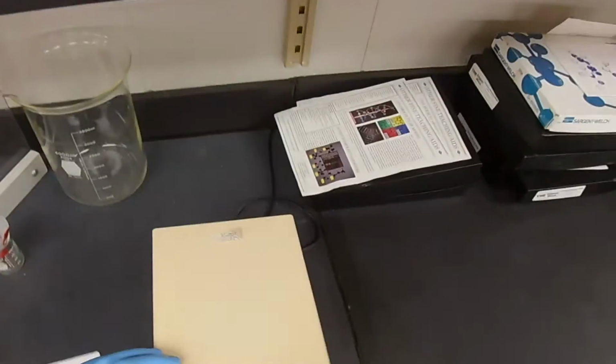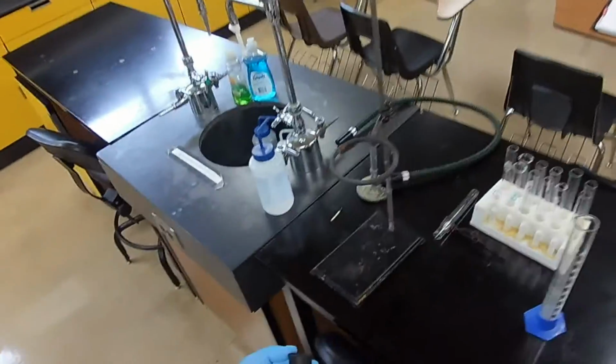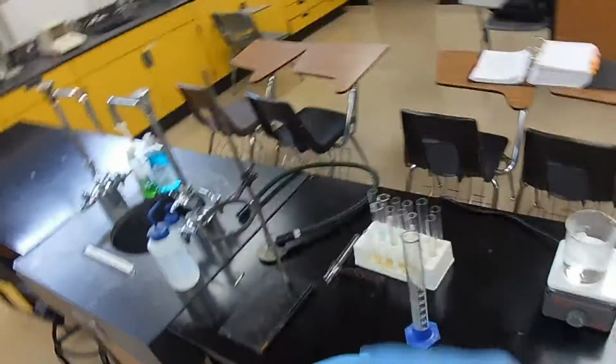Now we need the volume of the stopper. How do you get the volume of an object? Well, there are 2 ways. If it's a regular object, you can measure its dimensions. So if this were a cube, all we need is to measure the sides, or a rectangle, the sides.